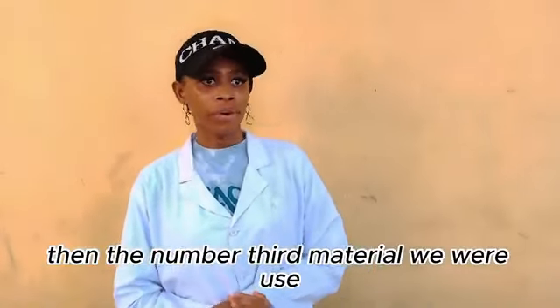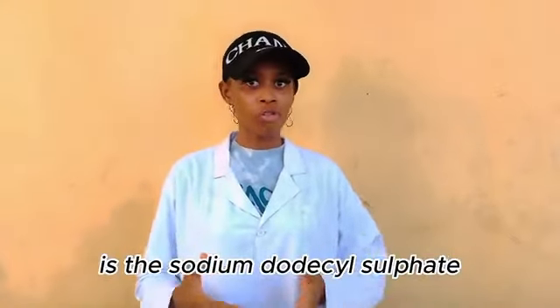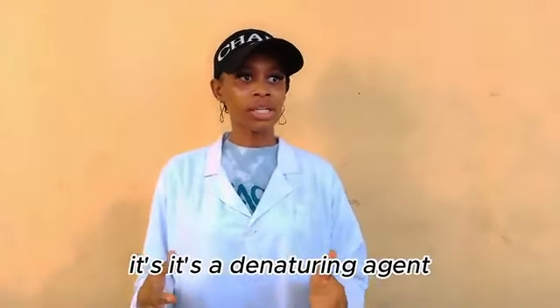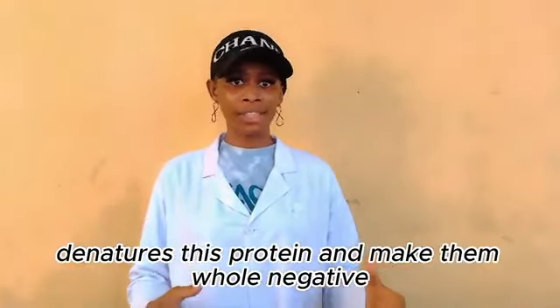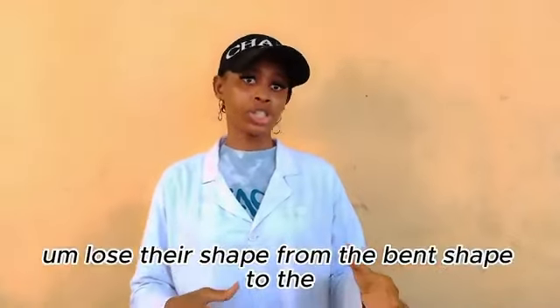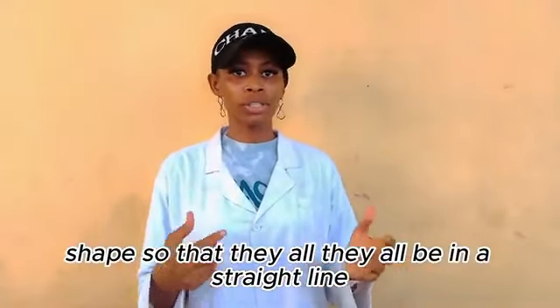Then the third material we are going to use in making this SDS-PAGE is the sodium dodecyl sulfate, which is the SDS. The SDS acts like a denaturing agent. It denatures the proteins and makes them wholly negative. From the positive to the negative, they make the protein lose their shape from the bent shape to a straight shape, so that they'll all be in a straight line.